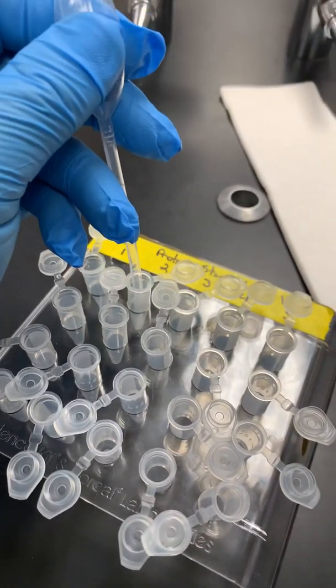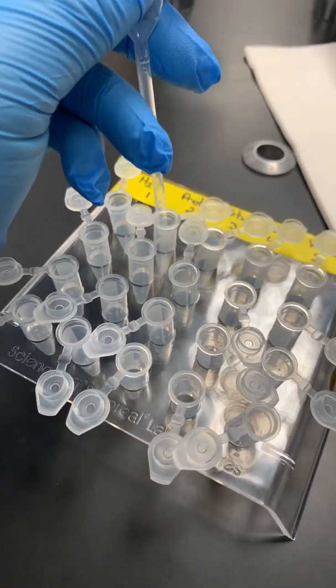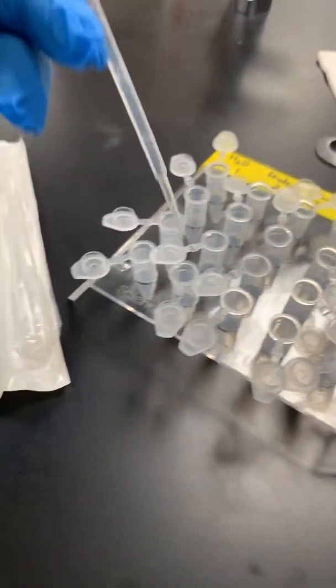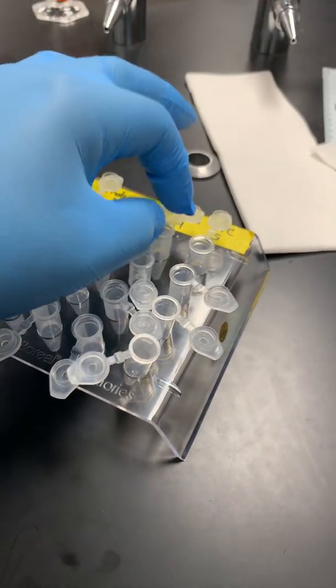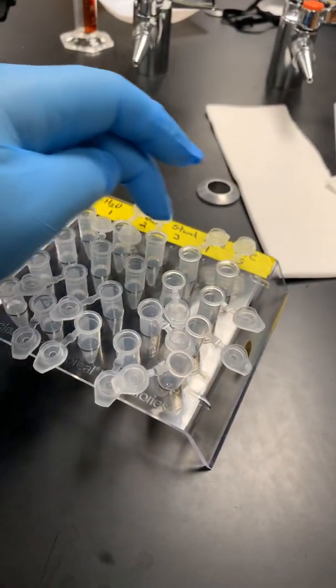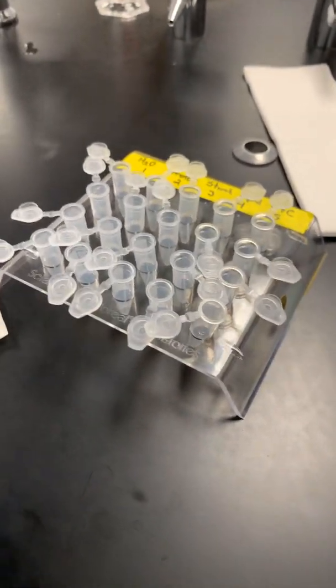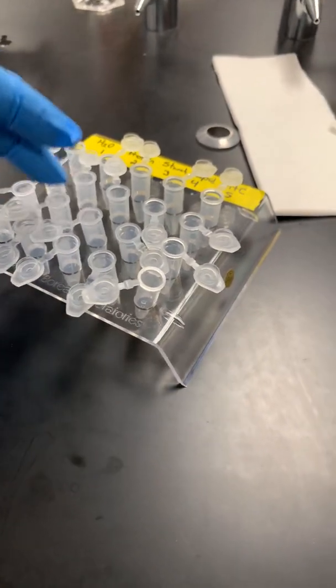So you'll open up another transfer pipette. Let's say I just opened this one, and then I'll go to the protein and I'll do the same thing. I'll draw up the protein and transfer into the first tube, go back, draw up from the protein stock tube, put it in the second tube there, draw up from the protein stock tube, and go to the third tube. Okay, so once you have all of these tubes filled up, your stock should be mostly empty. So all these tubes in row 2 should be mostly empty, because if you had 1.5 mils and then you took 3 times 0.5 mils, you should be almost empty. And with each of these having 0.5 mil in them now.